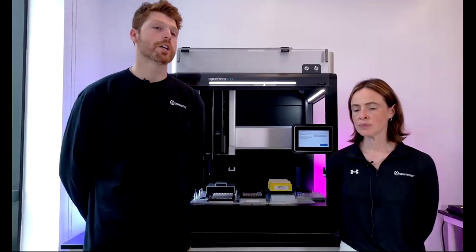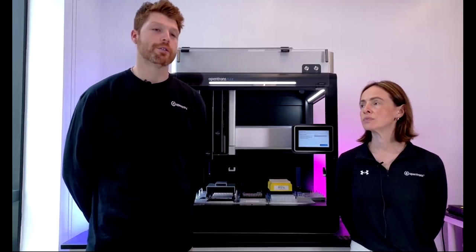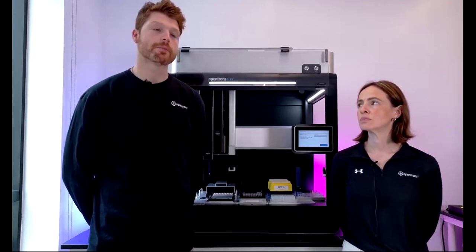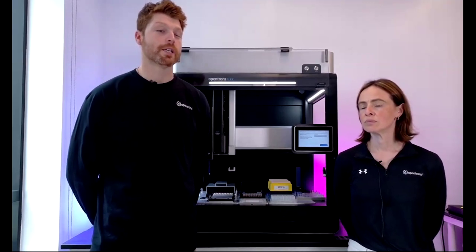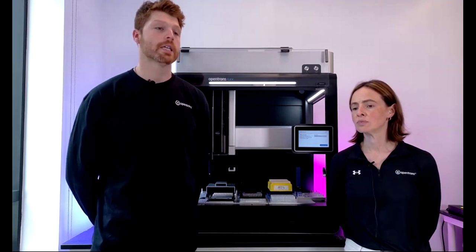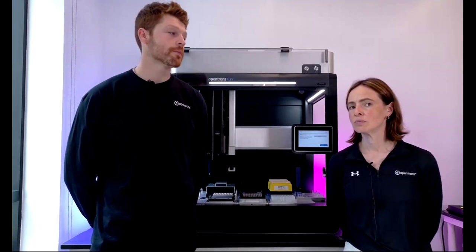Okay. Is the Flex able to integrate barcode reader functions and crosstalk with the LIMS regarding the readouts from a barcode reader? So currently we do not have a barcode reader integration. That would make it possible to reach out to a LIMS or store information in that. That is certainly on our roadmap as well.